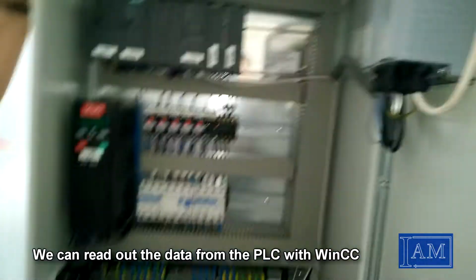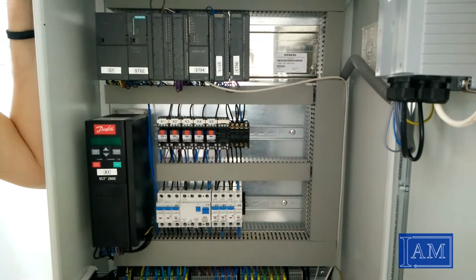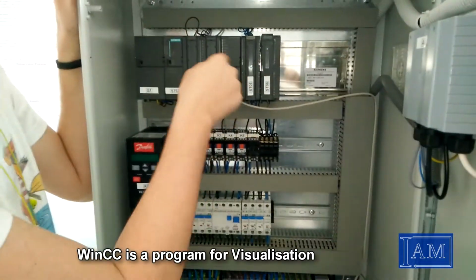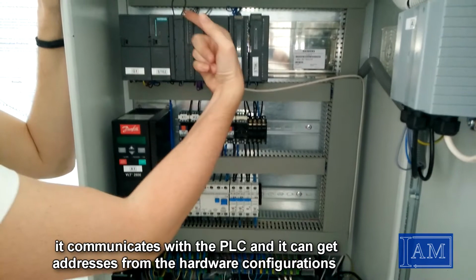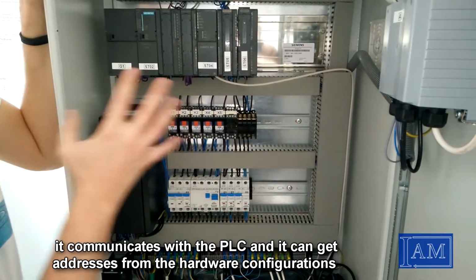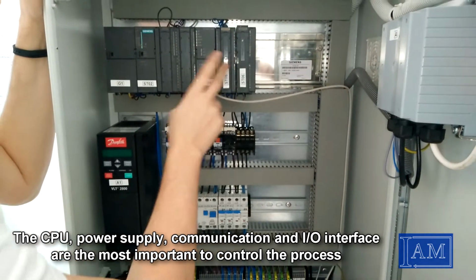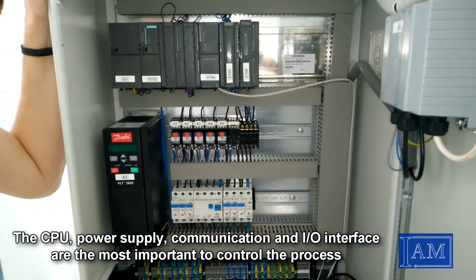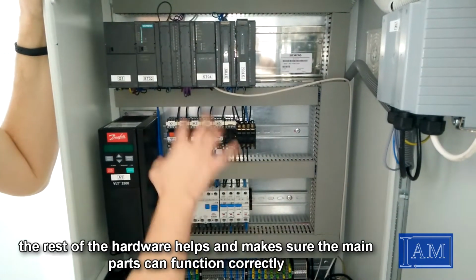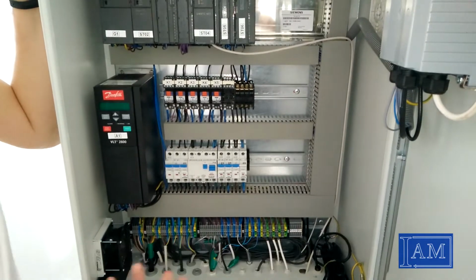We can read out the data from the PLC with WinCC. WinCC is a program used for visualization. It communicates with the PLC and it can get addresses from the hardware configurations. The CPU, power supply, communication and I/O interface are the most important things to control the process. The rest of the hardware helps and makes sure the main parts can function properly.